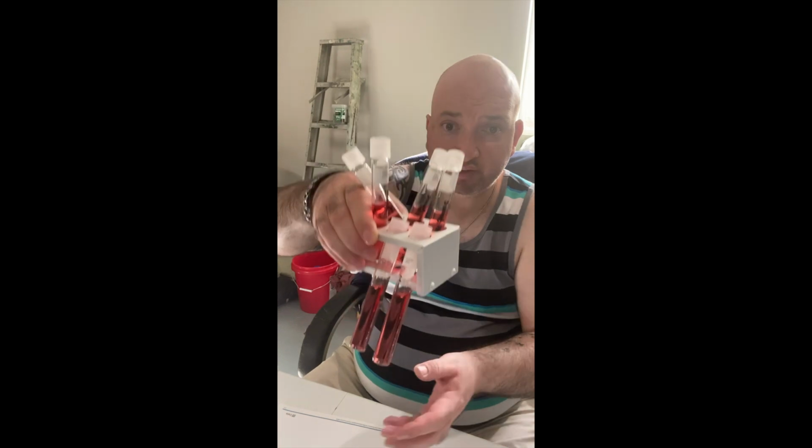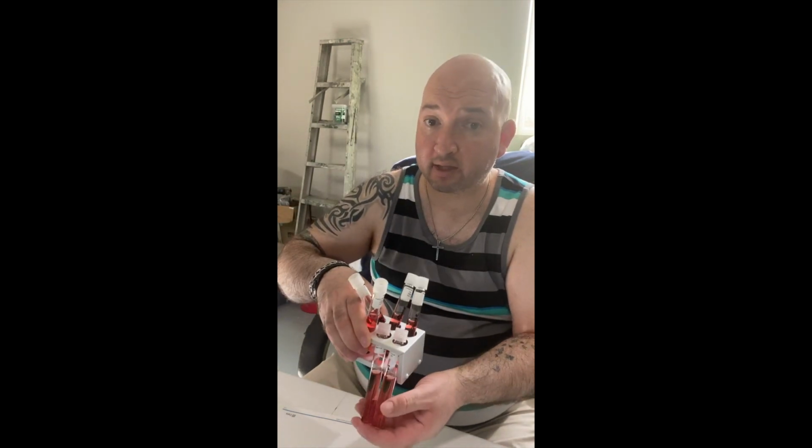So if either the S. epidermidis or the S. cerevisiae cultures that I'll be using in the phenol red broths here do ferment, I will see bubbles in the Durham tubes. I will also be adding sugar powders to the Durham tube. So I have glucose, fructose, and mannitol to add.